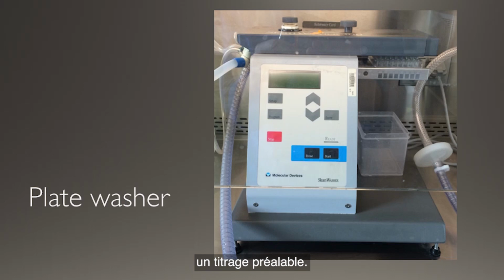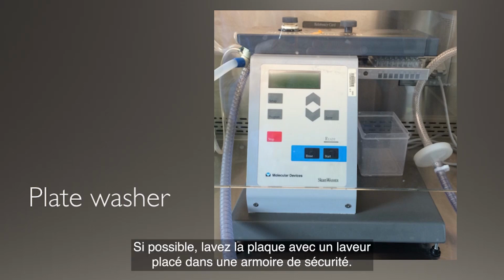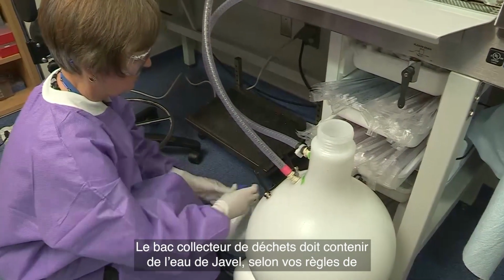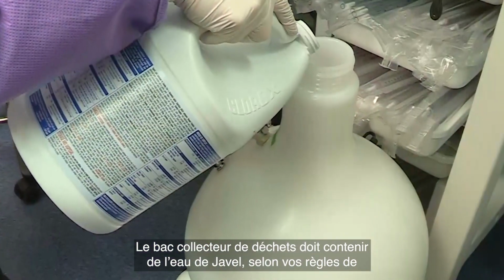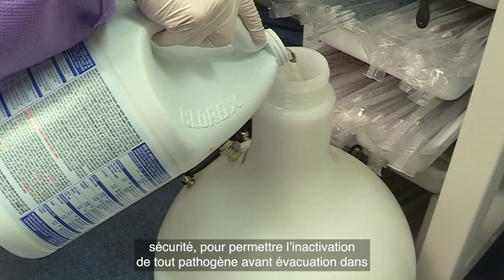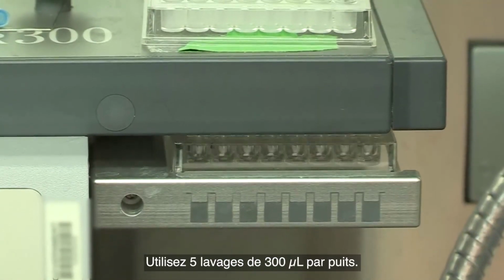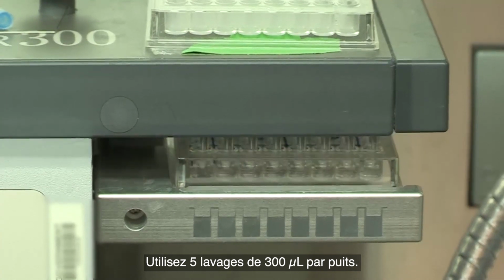titration. Wash the plate using a plate washer located inside a safety cabinet, if at all possible. The waste collection vessel should contain bleach according to your safety regulations to allow for inactivation of any pathogenic substances prior to disposal down the drain. Use 5 washes of 300 microliters per well.